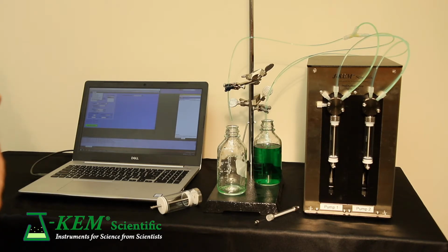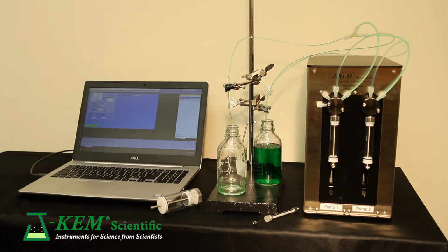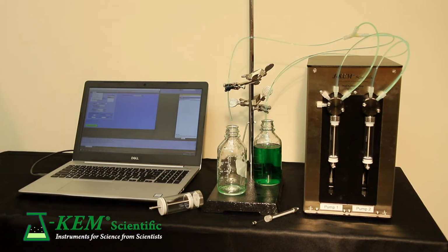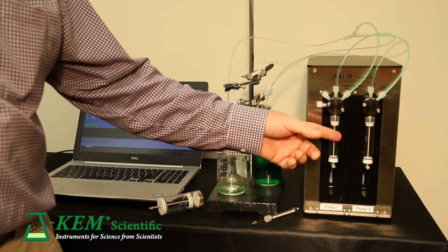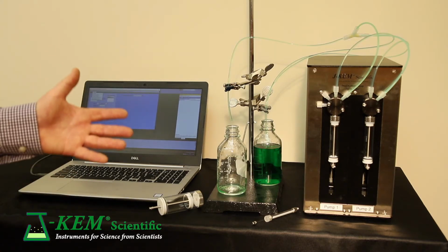But what's even equally important with that is the very wide speed range they have. If you put on a 10 microliter syringe, you can get down to delivery rates as low as 3 nanoliters a minute. And if you were to put on a 50 milliliter syringe, you could get up to flow rates as high as 750 milliliters a minute. Even with the 10 milliliter syringe that I have on here, the flow rate using just this syringe can range from 3 microliters a minute up to 150 milliliters a minute, which is a flow factor of 50,000.